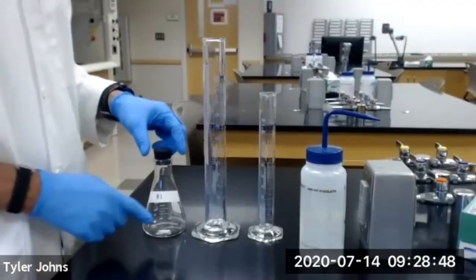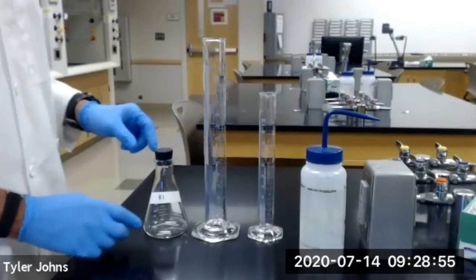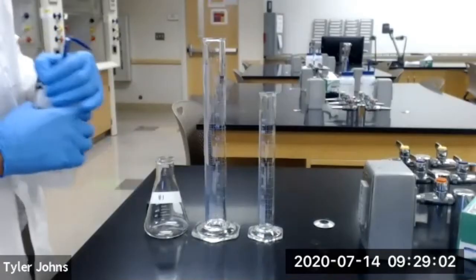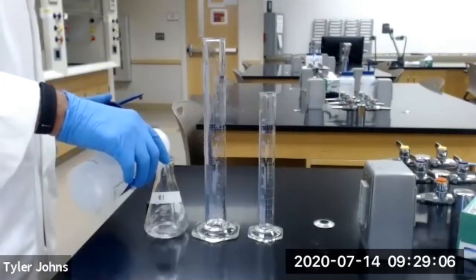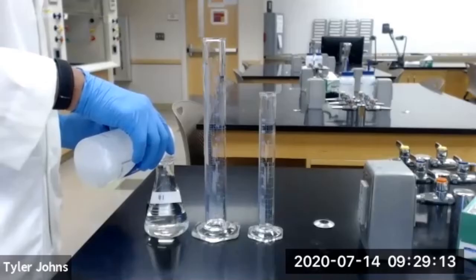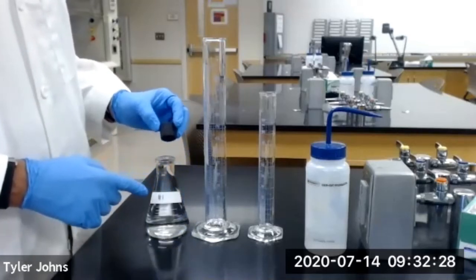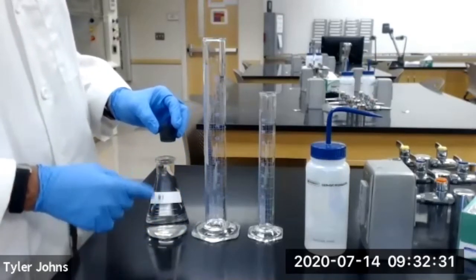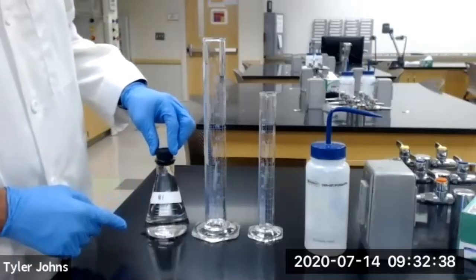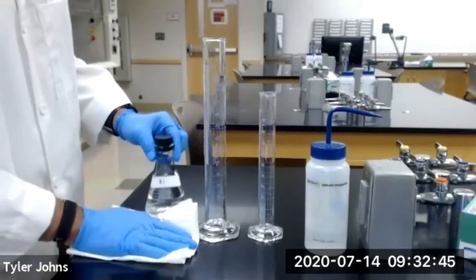We now need to determine the total volume that the carbon dioxide gas is occupying in our 250-milliliter Erlenmeyer flask. To do that, we're going to remove the stopper and fill our Erlenmeyer flask with deionized water. We'll then return the stopper to ensure we capture only the volume our carbon dioxide gas was occupying. You'll have some water overflow from the flask, and we'll wipe that up with a paper towel.